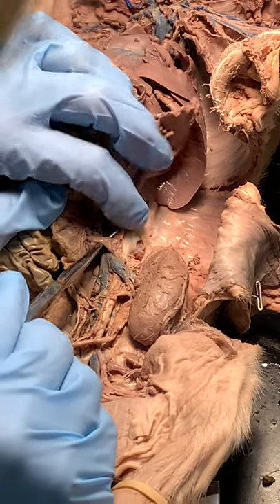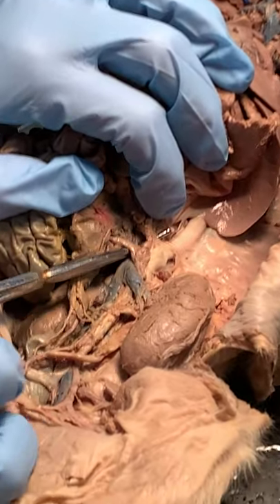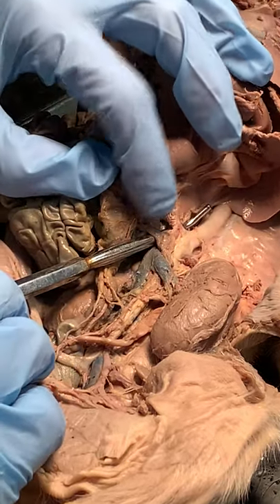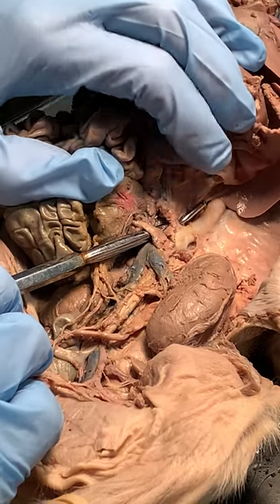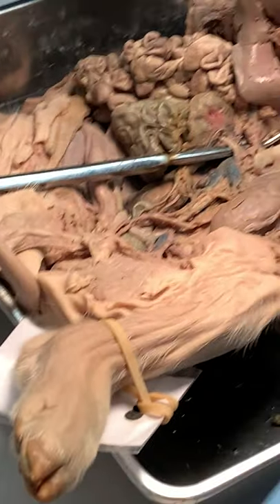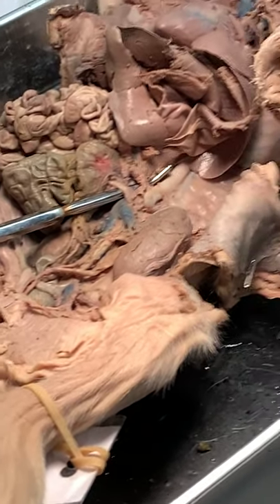Now you can see the celiac and the anterior mesenteric. So what's the difference between them?